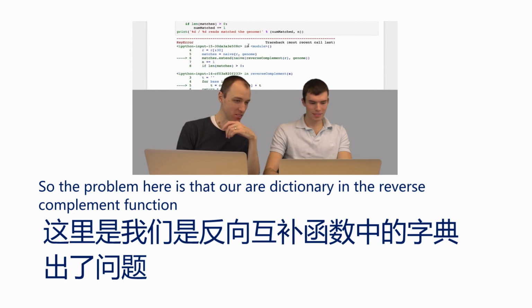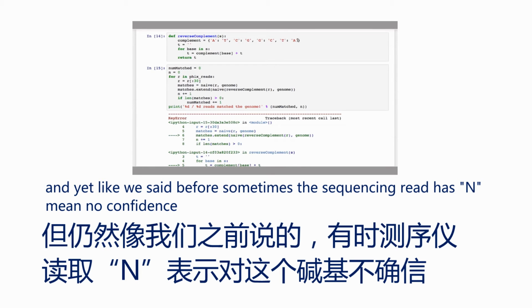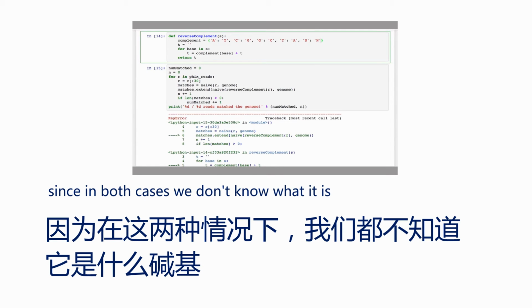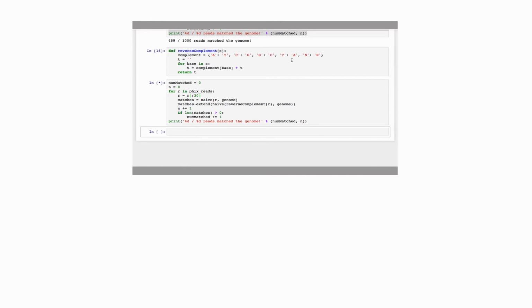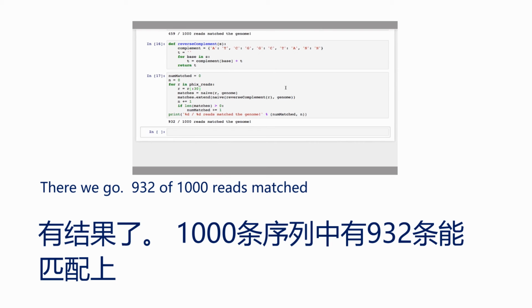So the problem here is that our dictionary in the reverse complement function doesn't allow for there to potentially be an N in a sequencing read, and yet, like we said before, sometimes a sequencing read has an N, meaning no confidence. So we just have to add one more key value pair to our dictionary there. So I'll just add the base N, and this will just match to an N, since in both cases we don't know what it is. Yeah. So let me update that and run it again. It's taking a little longer because it has to do more matching now. There we go. 932 out of 1,000 reads matched.